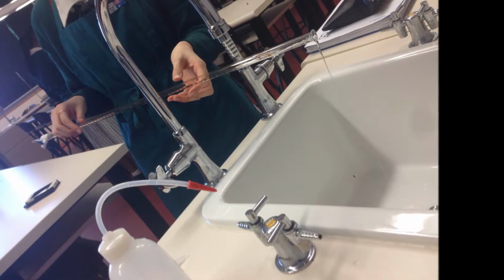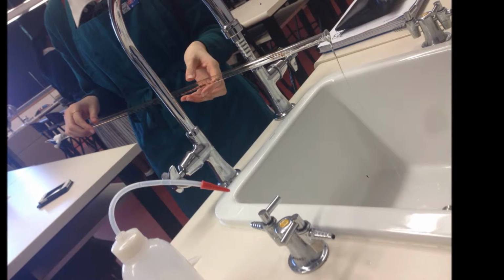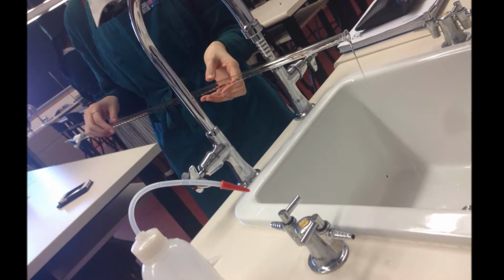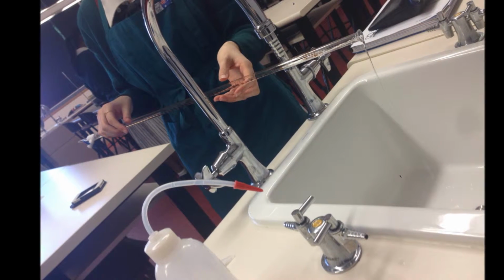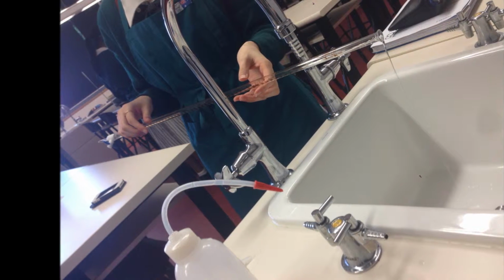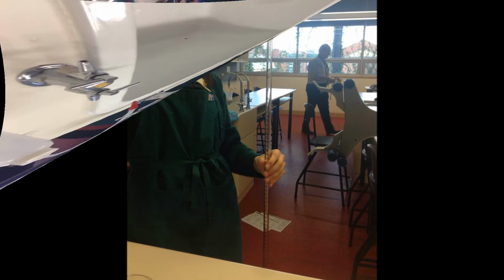Step 1. First begin by rinsing the burette with deionized water. Tap water cannot be used as it contains ions and impurities which can affect the results obtained. Then, rinse the burette with the solution it will contain, in this case the primary standard. This helps to minimize dilution as a result of leftover droplets of water.